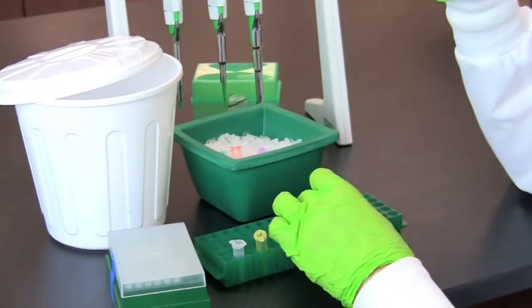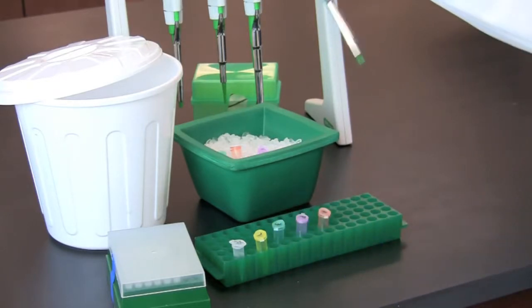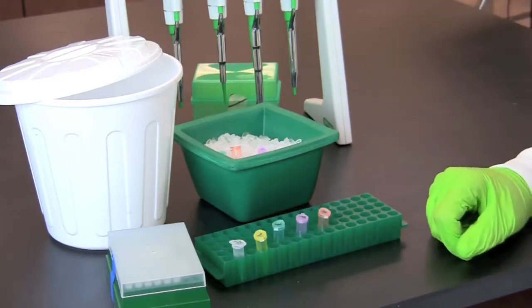When you have finished placing restriction enzyme into each tube, mix the components by gently flicking the tubes.